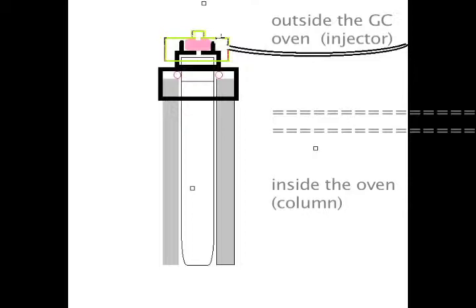The port liner is just sitting there and the o-ring is just sitting there. They just pull them both out, put the new port liner in, slide the o-ring over it, slide the black nut over that, snug it down. Put the new septum in, put the green nut back on and snug it down, and that's pretty much all there is to it.